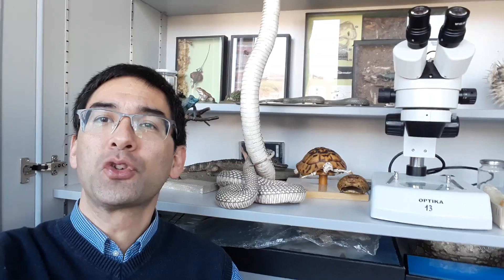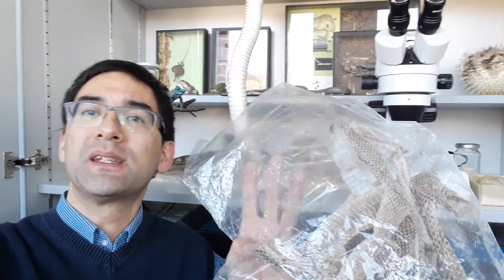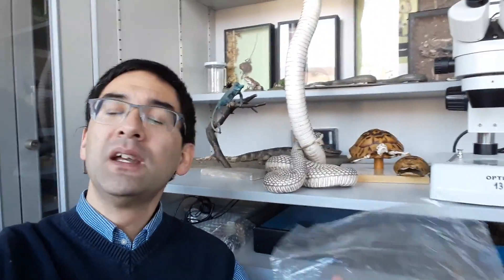Specifically, I want to look at snake skin under the stereomicroscope. A student several years ago found some snake skin in the forest and brought it to school, and I would like to look at this today.